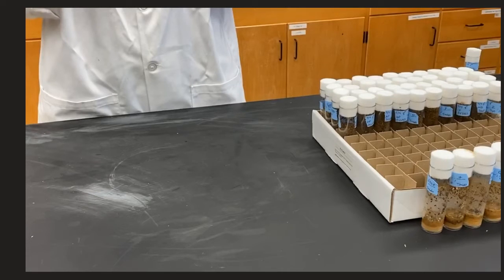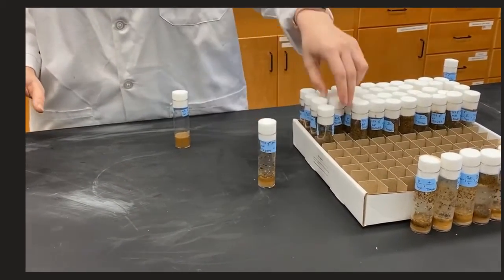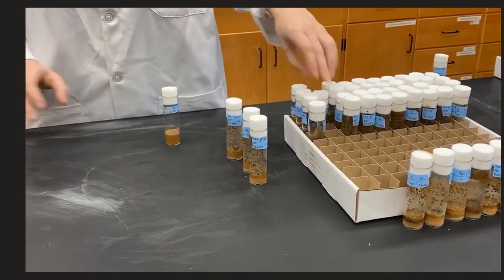We will be using all three of the back vials for this flip and not the newest vial. Here you can see the tray of vials. Nicole has the new vial and is removing the last three vials in the column.